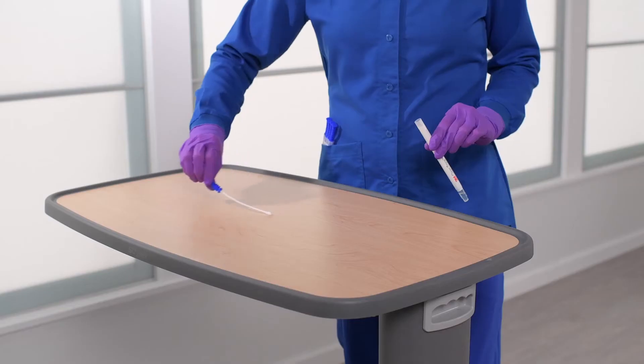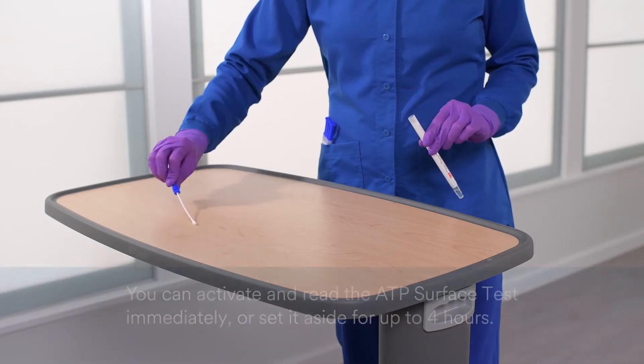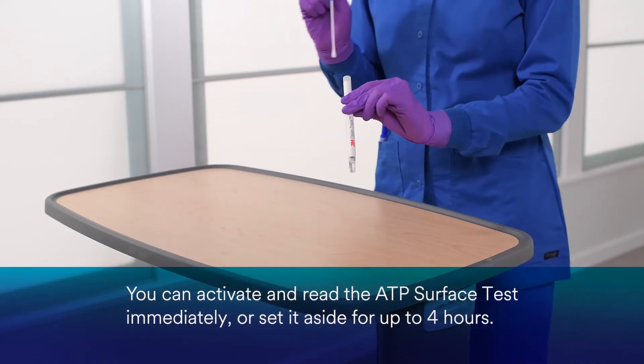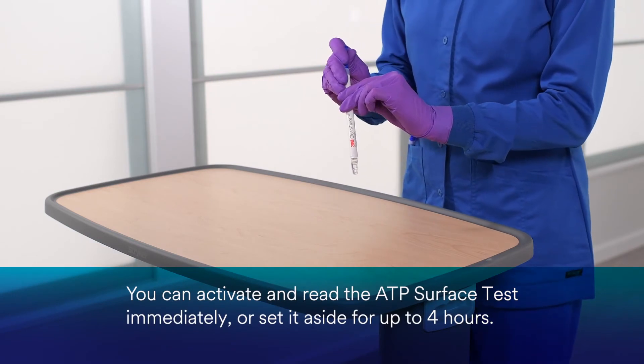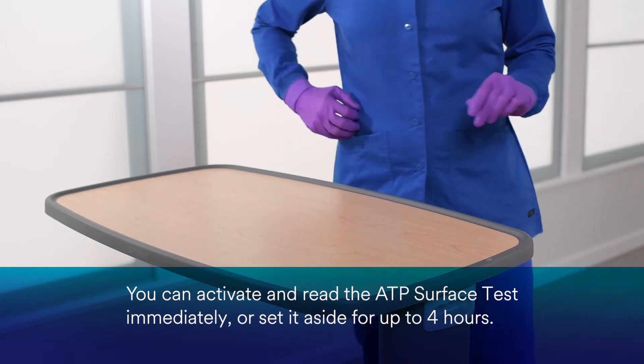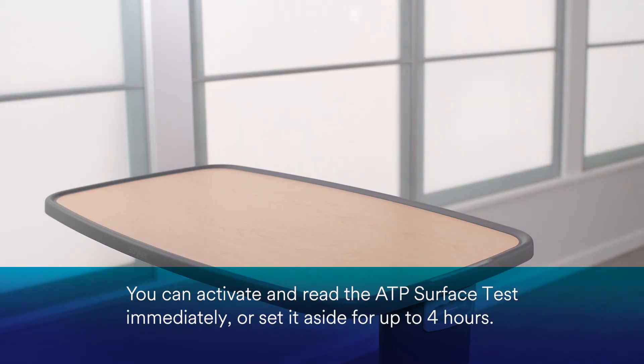Continue this process until your full sample is collected. You can activate and measure this test immediately or you can wait until you have collected multiple surface samples. You have up to 4 hours to activate surface tests.